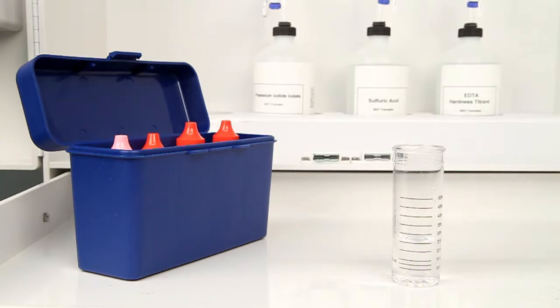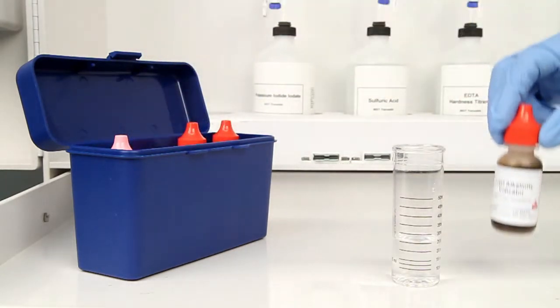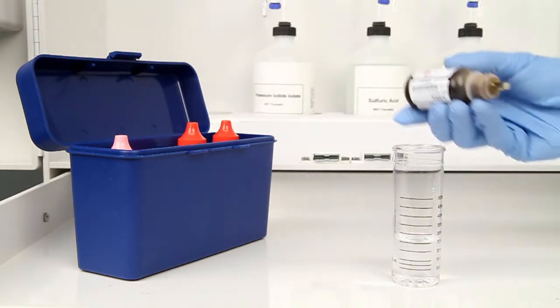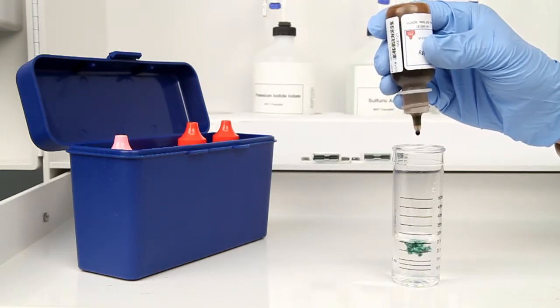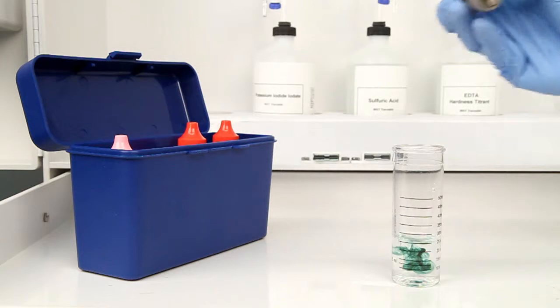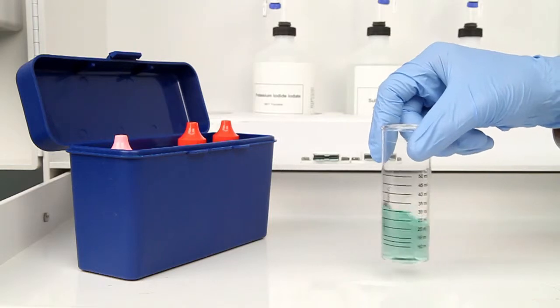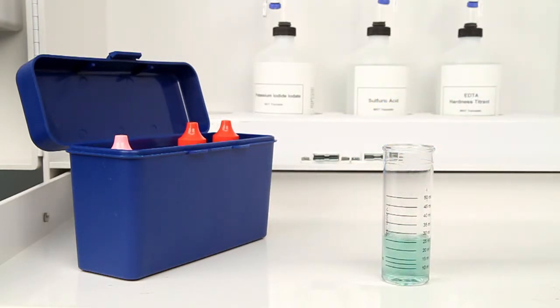The next step according to the Endpoint ID procedure is to add three drops of the total alkalinity indicator. The bottle contains a dropper tip, so it's important to hold the bottle vertically to get a consistent drop size. After the addition of each reagent, it's important to swirl the vial to make sure the reagents are properly mixed. In this example, the sample is turned green, indicating that there is still alkalinity that needs to be titrated.